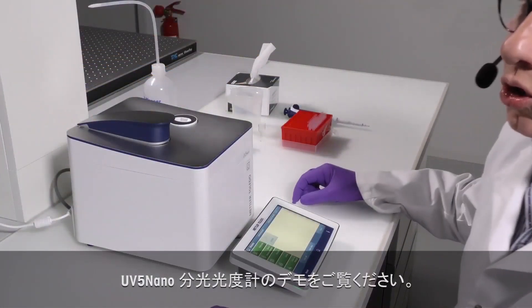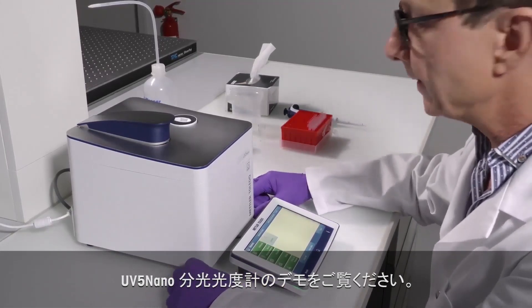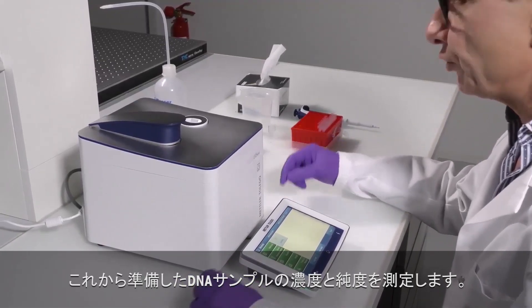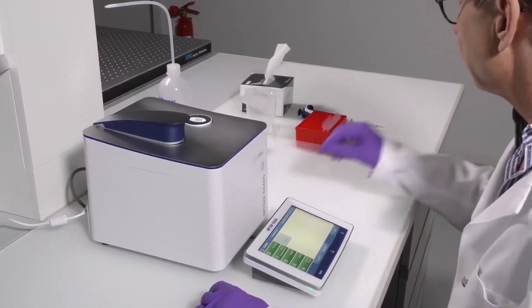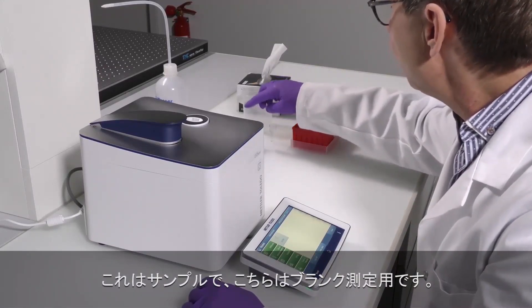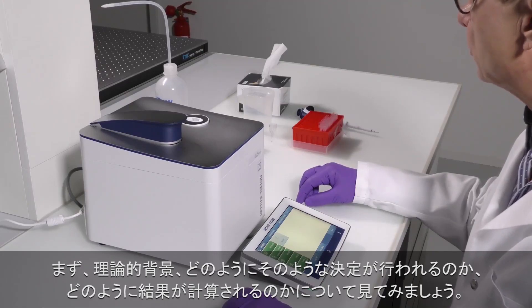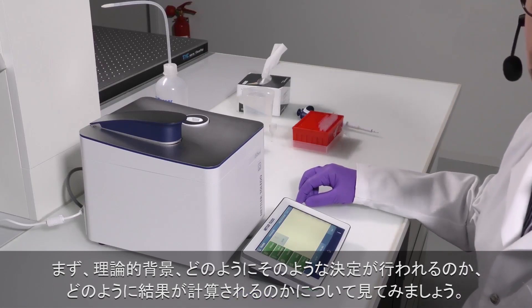I will conclude this brief introduction of the UV-5 nanospectrophotometer with a short practical demonstration. I have prepared DNA solutions, and we will measure the concentration and the purity of these DNA samples. As a blank in the measurement, I will simply use pure water. But let's first have a look at the theoretical background, how such a determination works, and how the results are calculated.